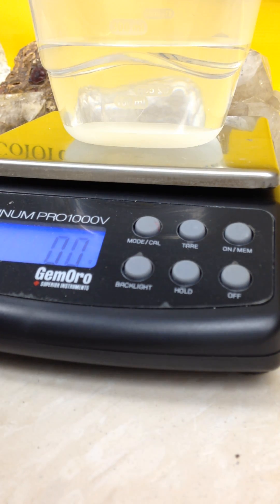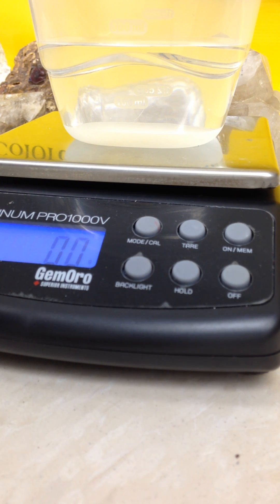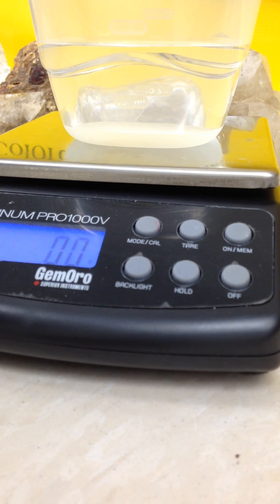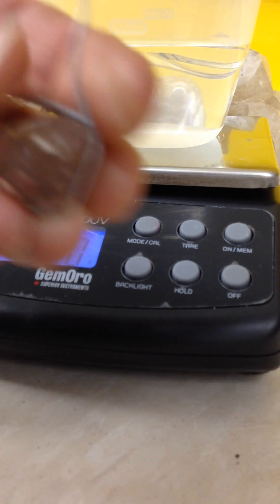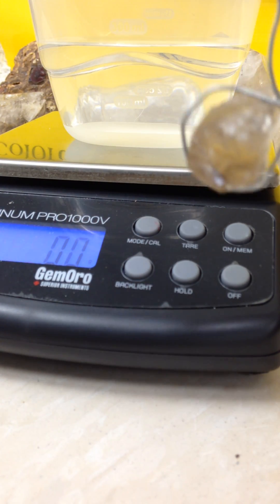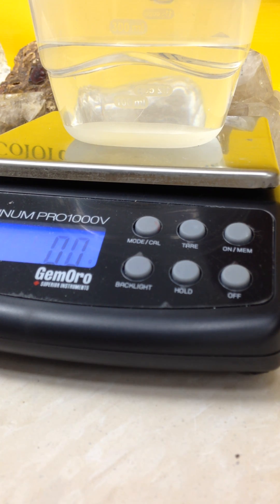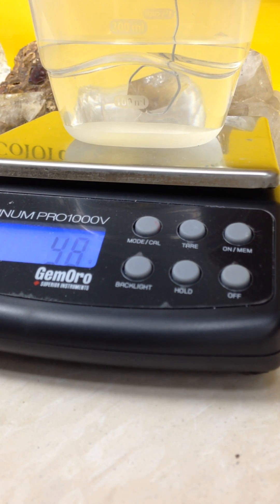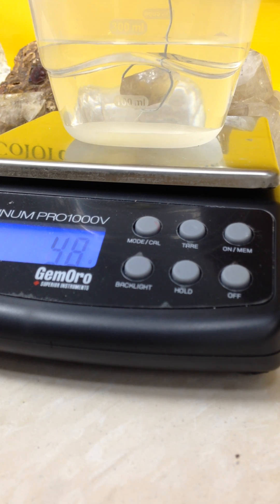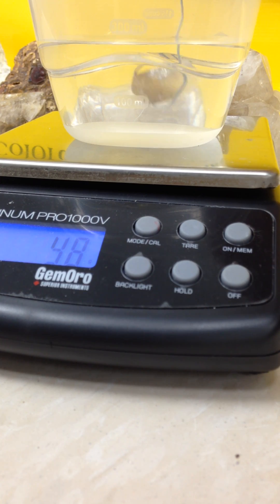The next thing you need to do is suspend your mineral in the water, and that's where the paper clip comes in handy. What I'm doing here is putting a paper clip around the mineral and suspending it in water — you don't want it to touch the bottom or the sides. As you can see here, the reading is 4.8, so we need that reading.